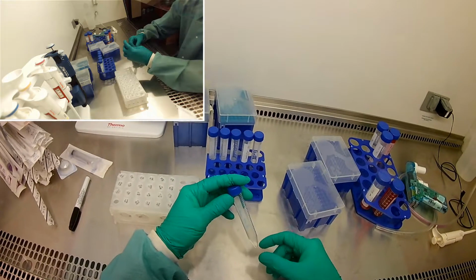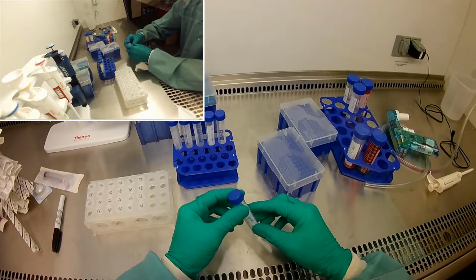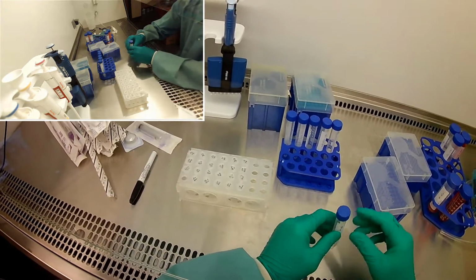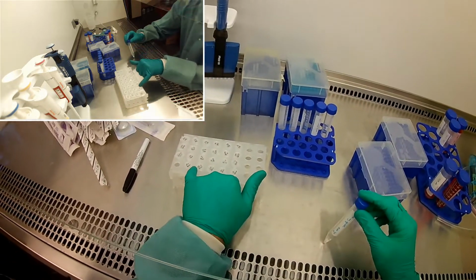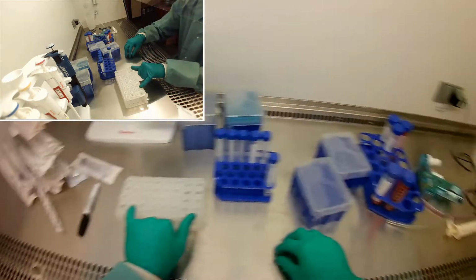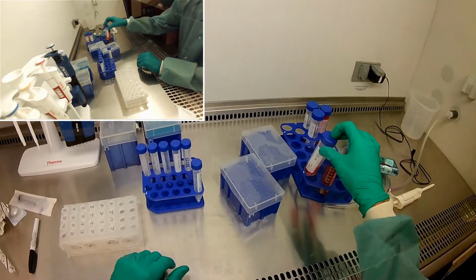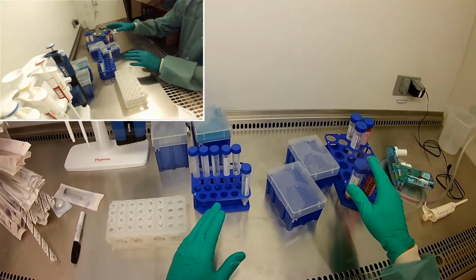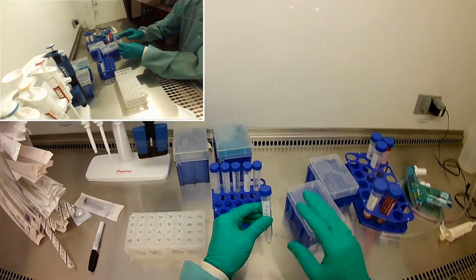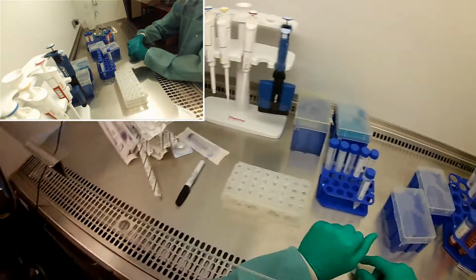I've already measured out the right amount of glucose to make the 27. And so when you do the math on this, you have to think about, we want 27 milligrams per mil total. This stuff already comes at 4.5 milligrams total, so you need to measure out, okay, now I need 22.5 plus 4.5, which will get me to 27. So I've measured that out already, and my first job is going to be dissolve that.